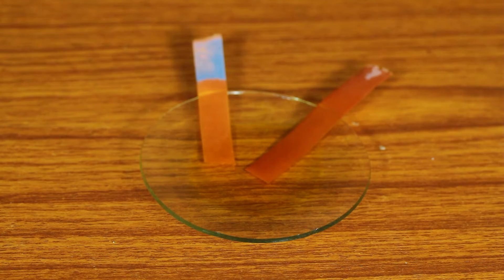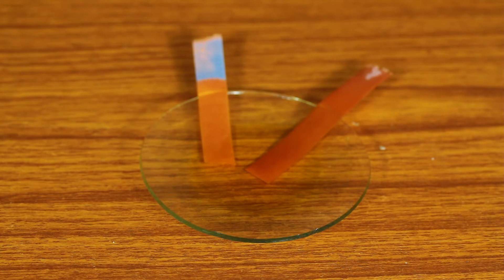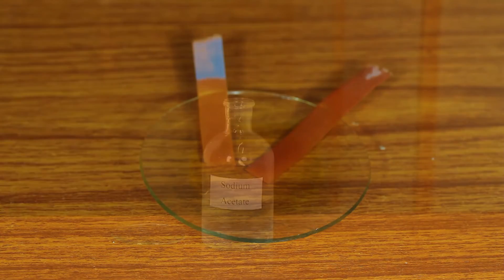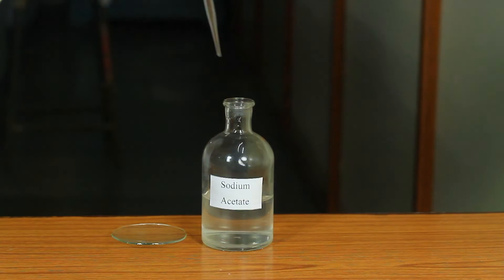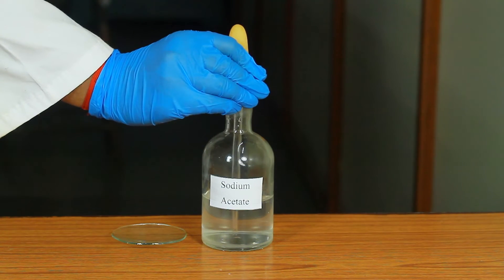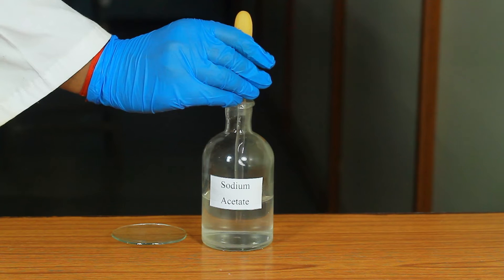Ferric chloride solution turns blue litmus paper red, but it does not change the color of red litmus paper. Take about 1 ml of sodium acetate solution in a watch glass.